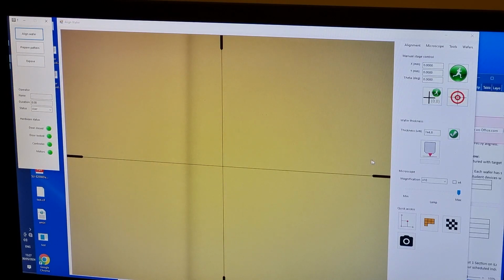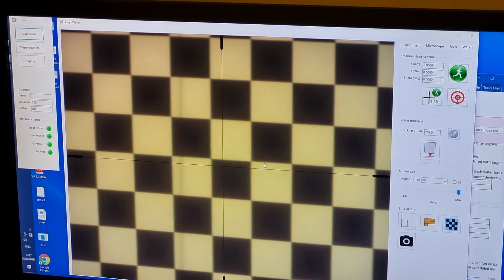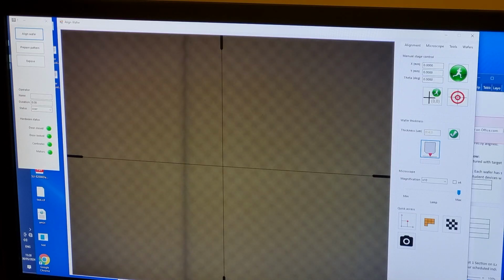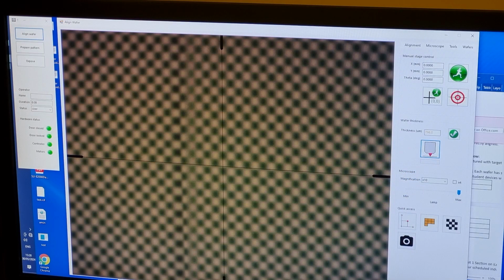Next, we need to focus onto the substrate. This is best done by typing in an expected thickness, turning on the manual checkerboard pattern, and using the mouse scroll wheel to move the microscope up and down until the checkerboard comes into focus. Now click the autofocus button, which is the icon with a small red triangle. The green progress bar beneath the autofocus button indicates that the autofocus routine has been successful.